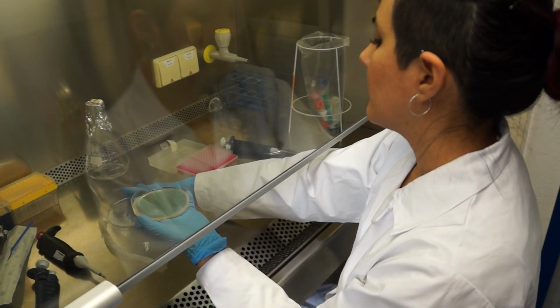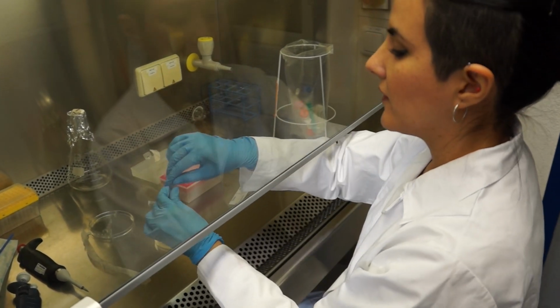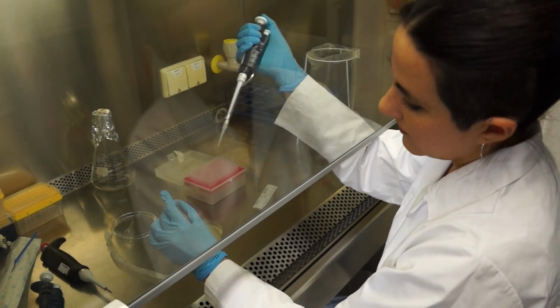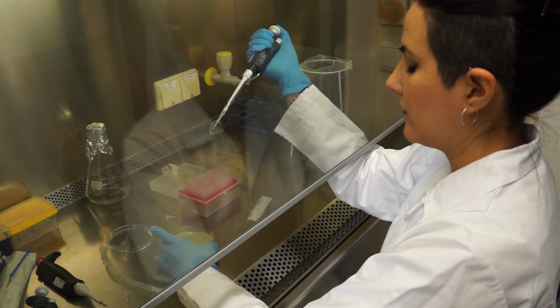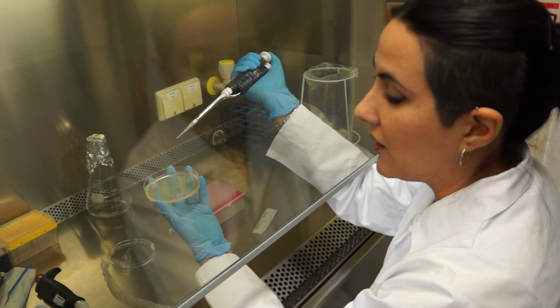So we have it there. And I'm going to take a little bit from here. And we will start the colony on the plate.